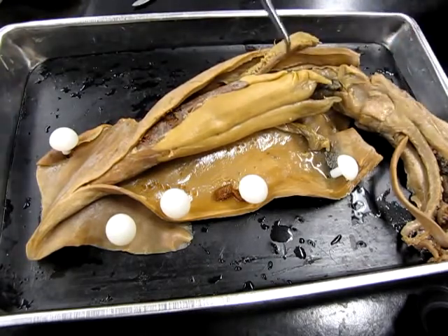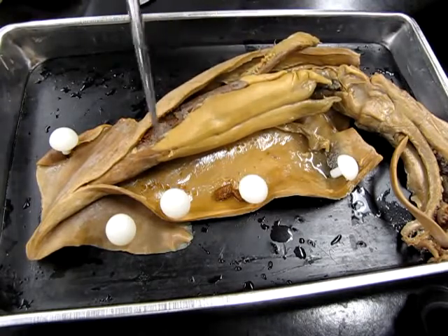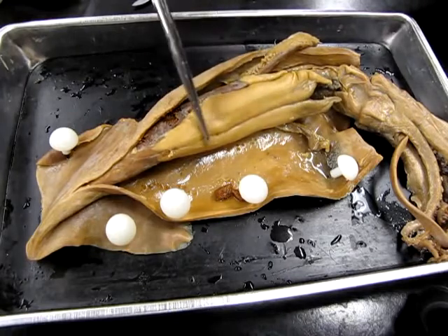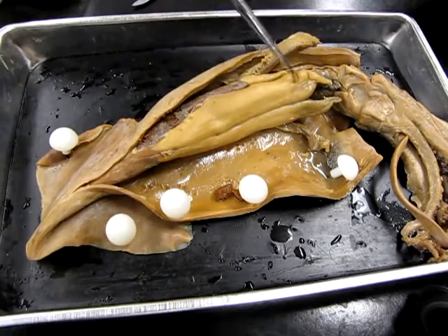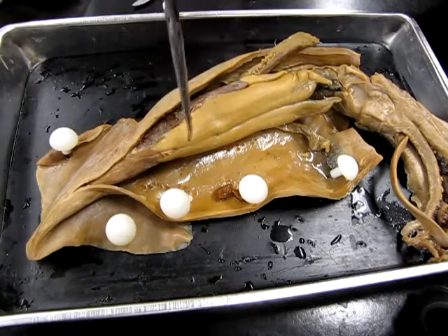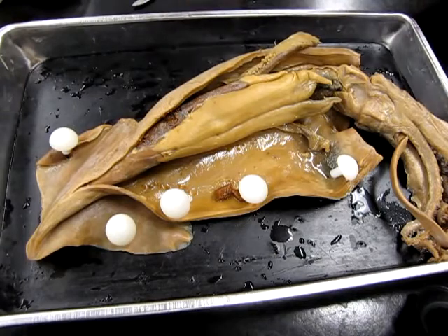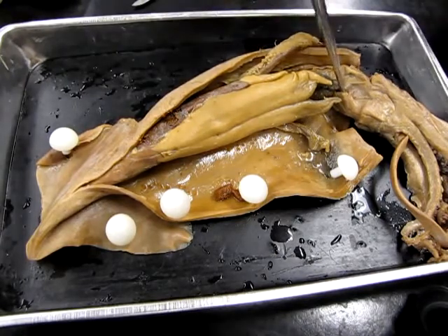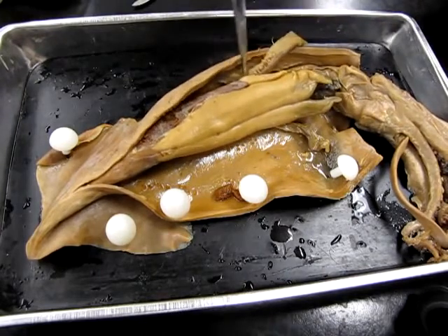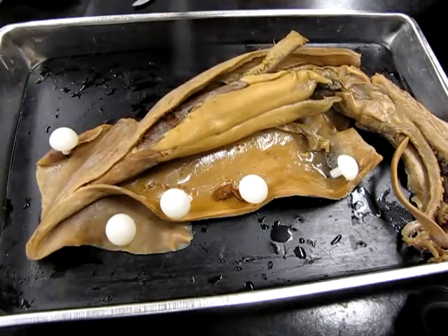Okay. Now the one thing that should be immediately apparent is these large beige structures on top of everything else. We did not see these in the male. These are the nidamental glands. They're only found in the female, and these are responsible for creating a secretion that covers the egg masses before they're ejected through the siphon to later develop into little larvae. So these are the nidamental glands.